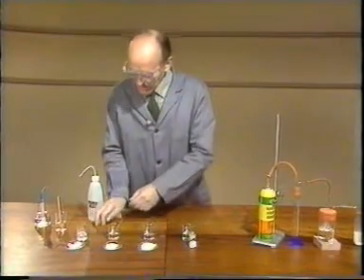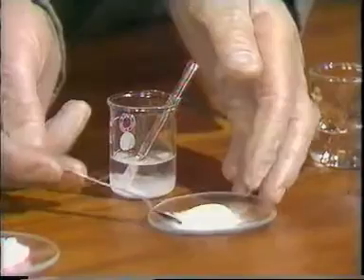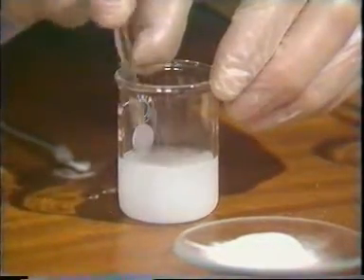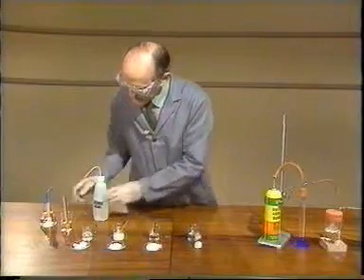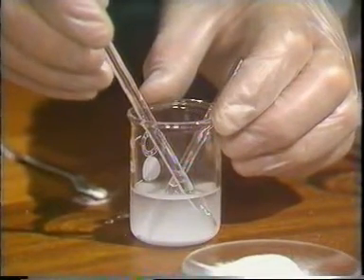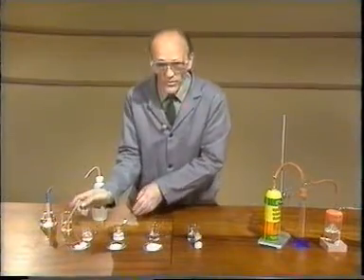Now let's try aluminium oxide. Aluminium oxide is also a white powder, and if I put some of this in the water and stir, again very little seems to be happening. But I'll check the temperature, rinse the thermometer, and again the temperature is still 22, there's no sign of any change. We'll come back to these to measure the pH later on.